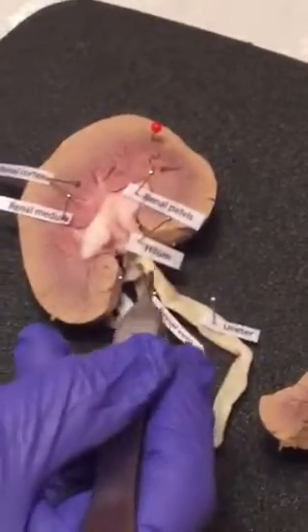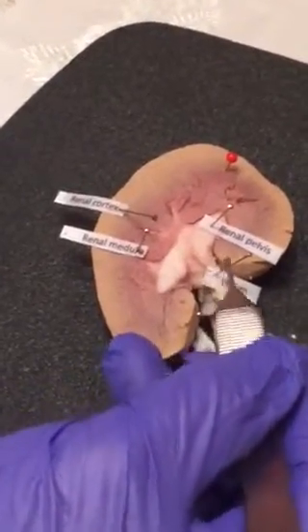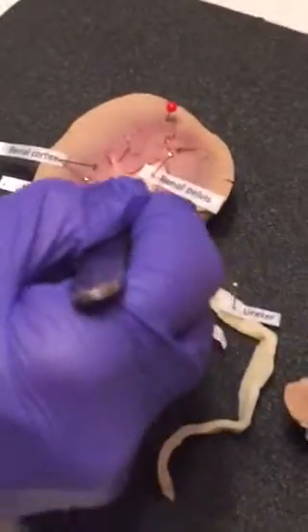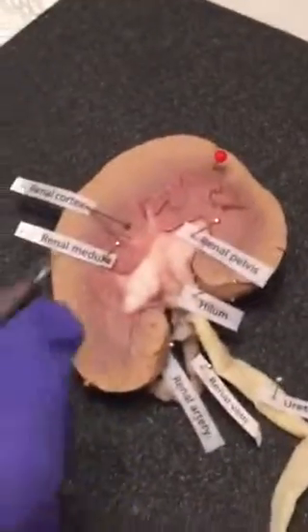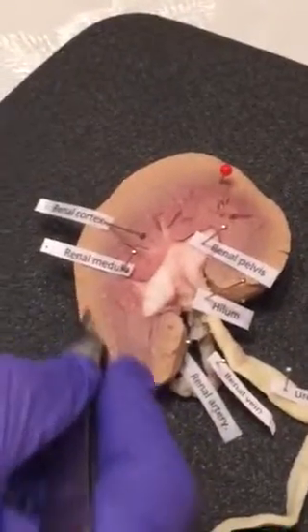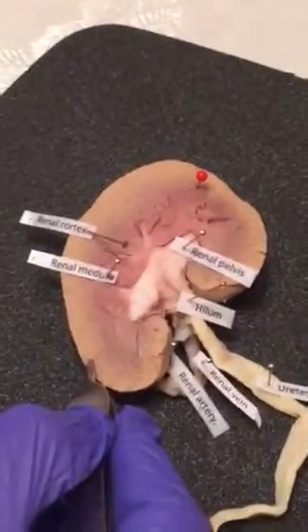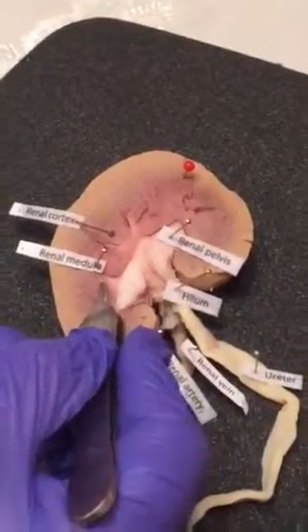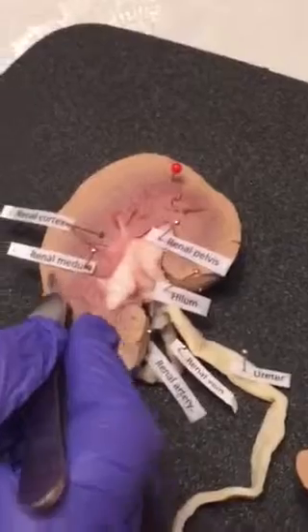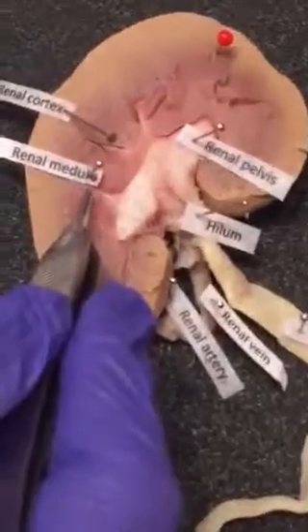Then we have the hilum, which is in this small concave portion here, and this allows the nerves, the veins, the artery, and the ureter to connect to the kidney itself. Like we said earlier, this is the renal cortex, the superficial outermost portion of the kidney, and it allows for ultrafiltration. Then we have the medulla, which we talked about earlier, and this has the renal pyramids inside. Like I say, you can't really see them, but they have the collecting tubules for the urine.